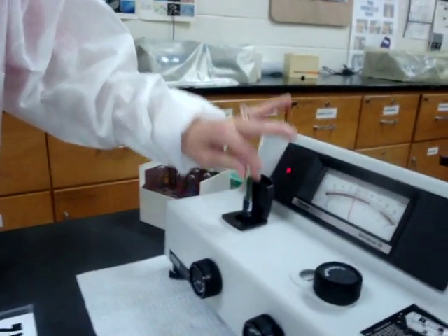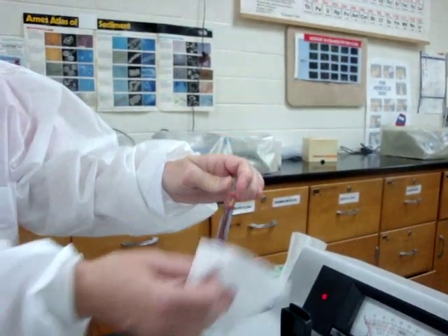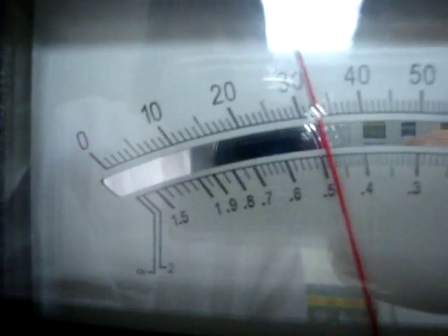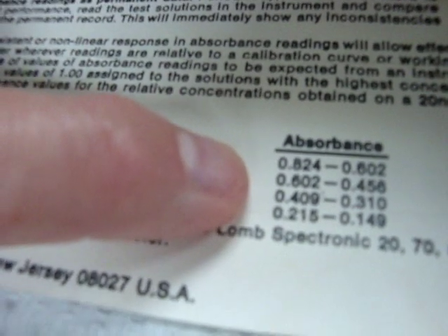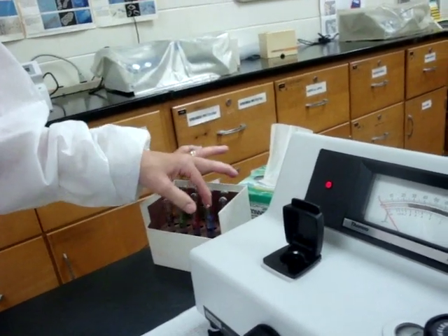Place the 0.50 back in the box and pick up the 0.75 concentration. Wipe fingerprints clean, place it in the sample compartment, close the lid, and take a reading. The 0.75 concentration reads 0.49. The chart shows it should be between 0.456 and 0.602 — so it's within range as well.